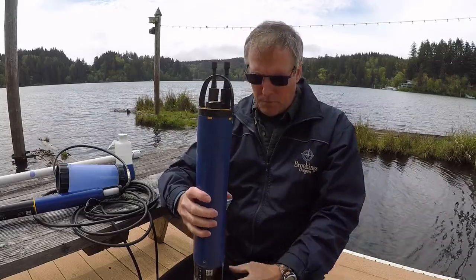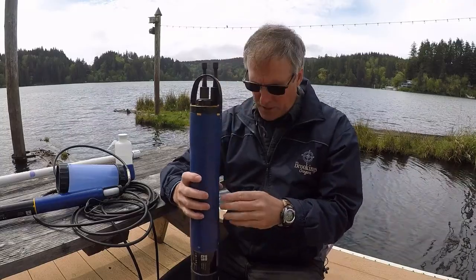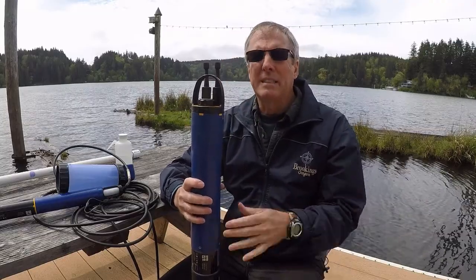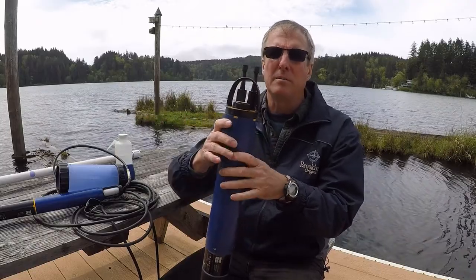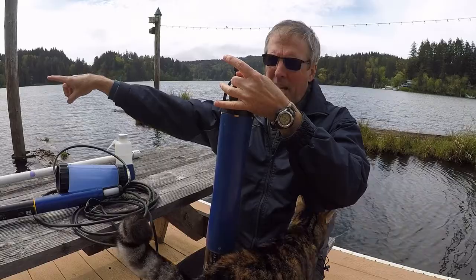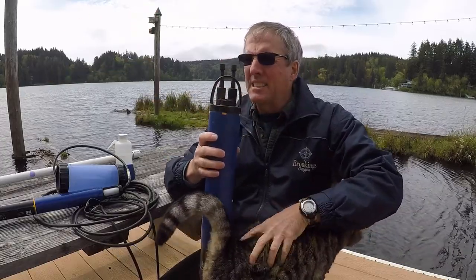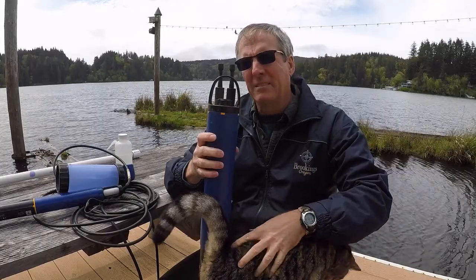So what we did in Eel Lake to solve that problem was to create a loop underneath the water. We tied one end here. We had a second anchor, and I think we used about 100 feet of line.